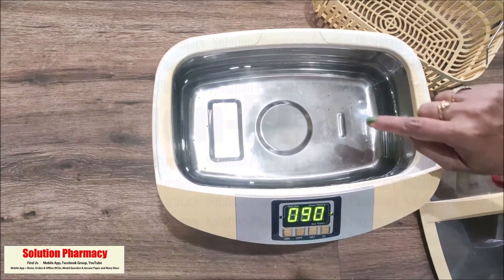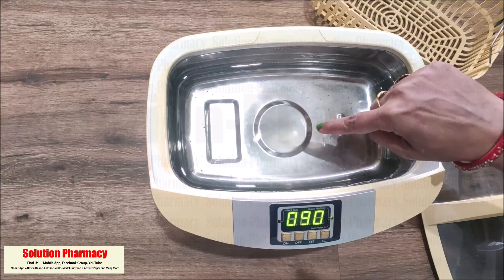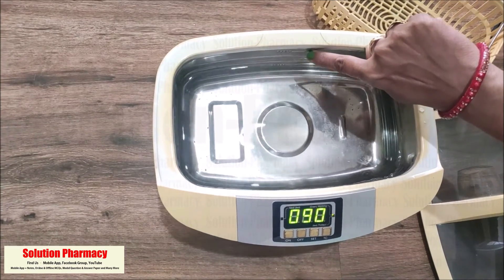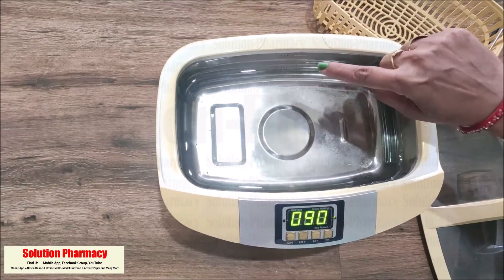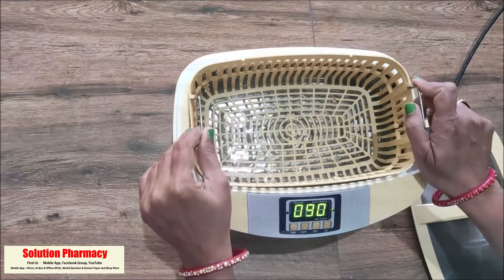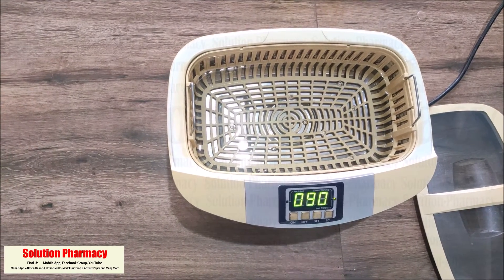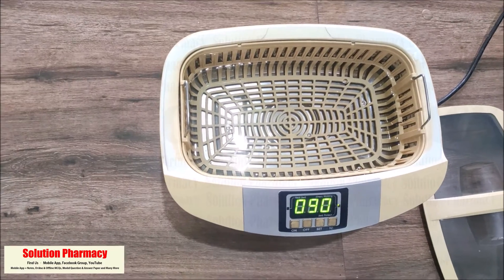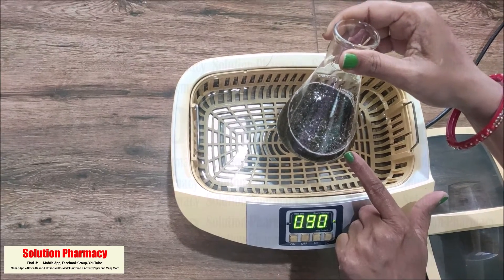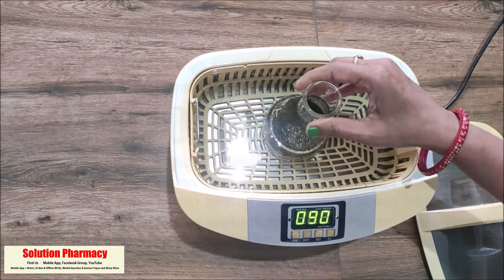Here you can see there is a steel bath, and we have already filled it with purified water up to the optimum level. There is a minimum and maximum level marked, and within this limit we have to fill the purified water — keeping the water level up to the recommended mark. After filling the water, place the basket back inside, and then place the container — such as a conical flask, volumetric flask, or beaker — containing the sample along with a suitable solvent into the ultrasonic bath.